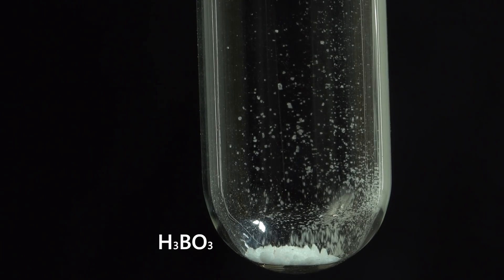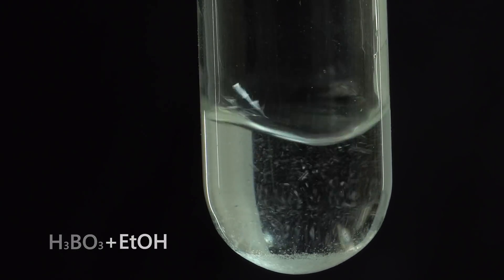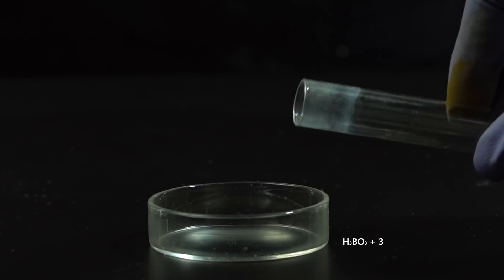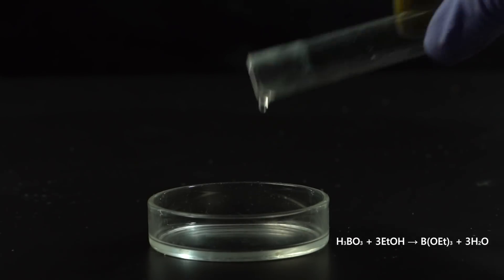I think you know this trick, where boric acid is dissolved into ethanol, is set on fire and then burns with a green flame due to the formation of triethyl borate.